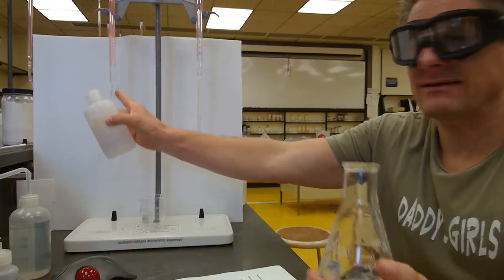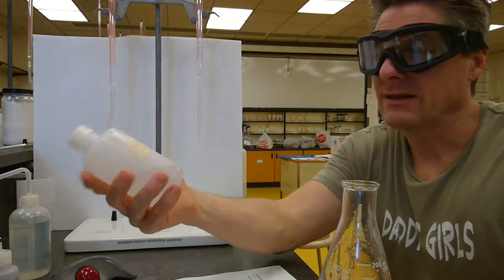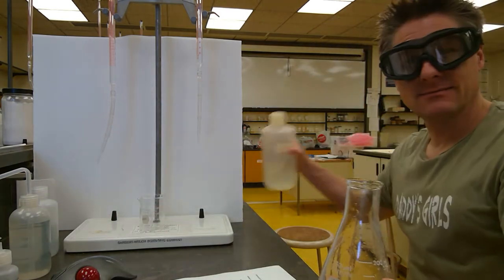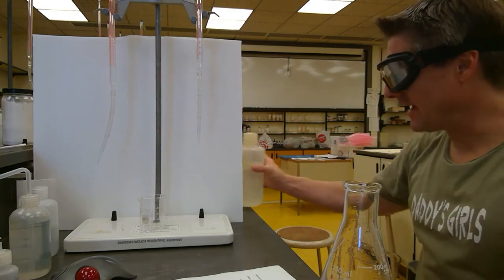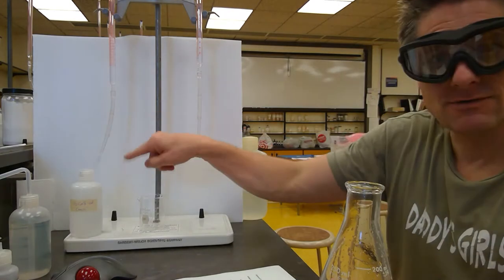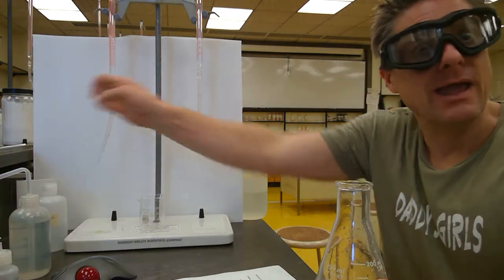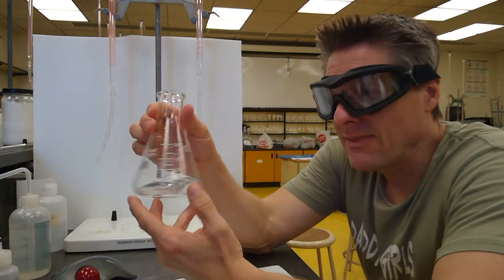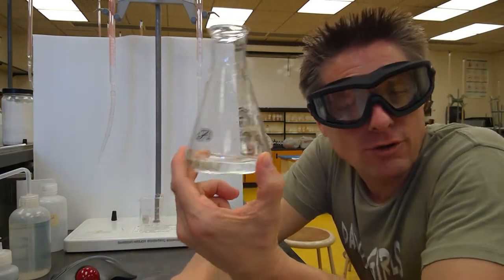So for a back titration, I like to put A before B. Let's say I know the concentration of this, and let's say the base, I know the concentration of that. I like to keep the bottles, right? So I know this is my base. I know this is my acid. I get confused, so I do A before B. Hopefully you don't get confused like I do. And then we'll have some known volume of an unknown acid.